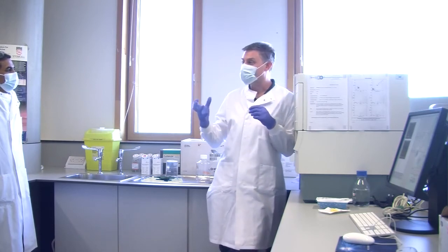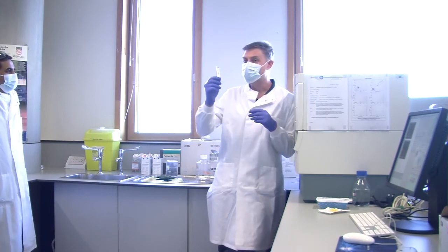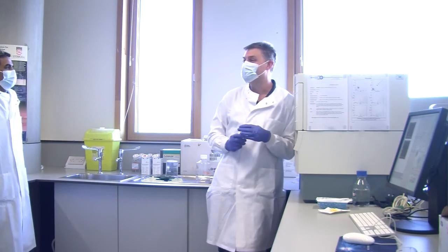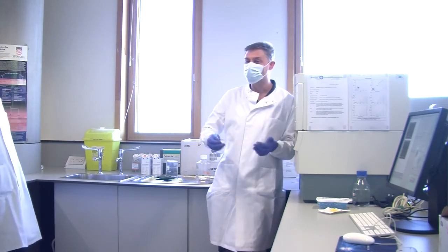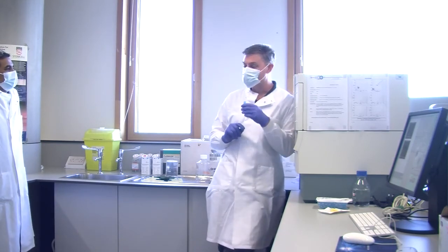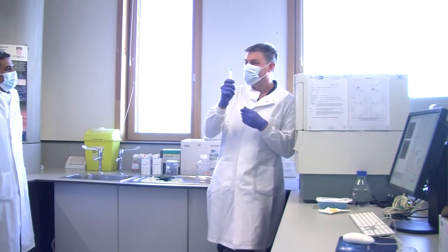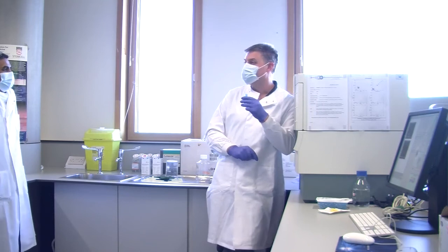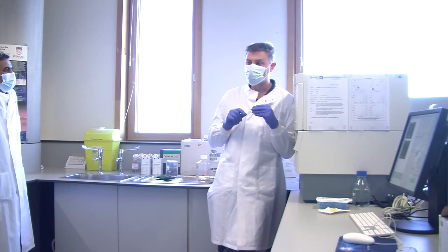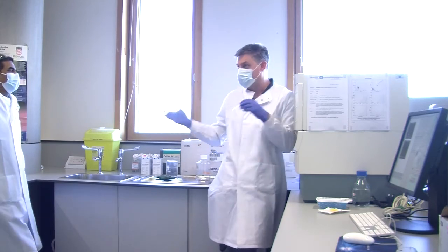What if your drug makes them very non-sticky, but normally they are? So you run your tube through and get 98.99%. Yay, it's worked brilliantly, I'm going to be a multi-millionaire, we've got this new drug that makes stem cells. Except what you've done is taken a 10% stem cell population, 90% of them are clumped together, and you've pulled them out with the filter. What you've got left is 98.99%, but that's not a true reflection of your actual data. I say this because experiments are complicated, with fluorochrome choice and so on and so forth.